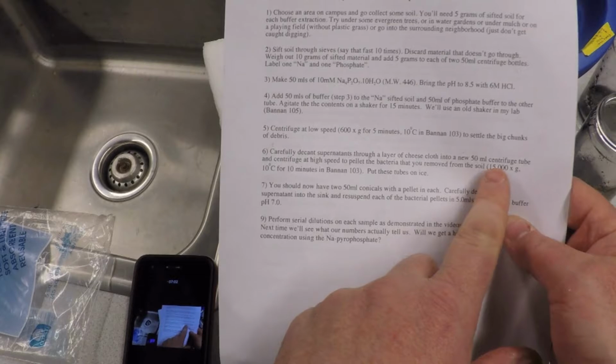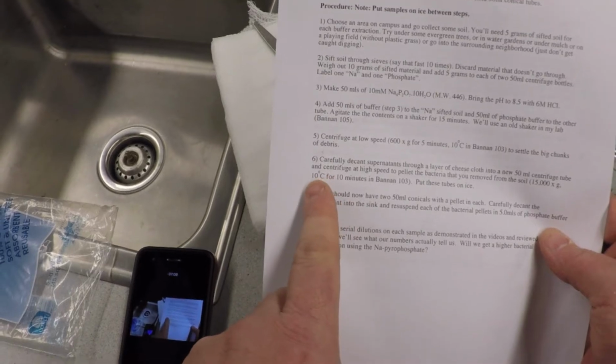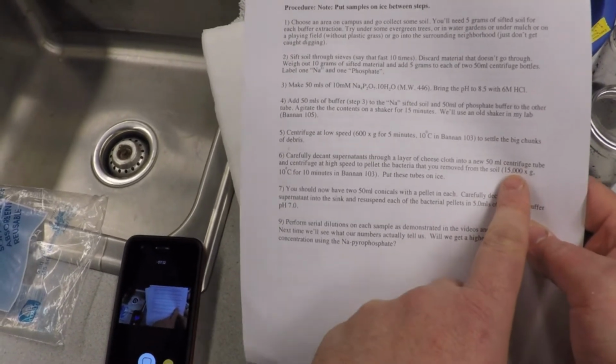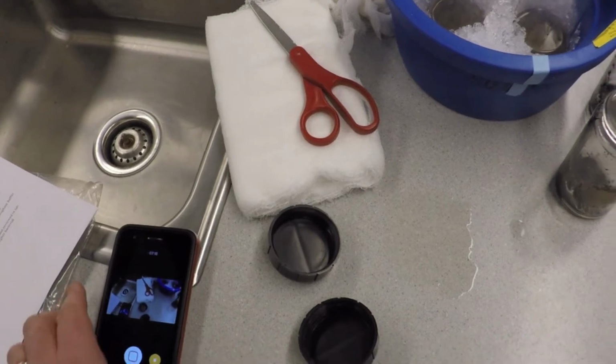Centrifuge at a high speed. So we want to do 15,000 times G. What in the hell? Say 10. We'll try 10. 10,000 times G at 10 degrees C. So we're going to go find out what makes 10,000 times G. We'll switch that in our procedure. What makes 10,000 times G with this rotor?